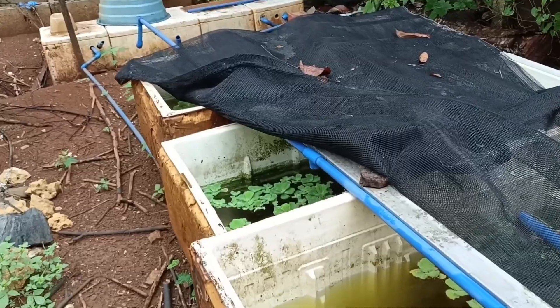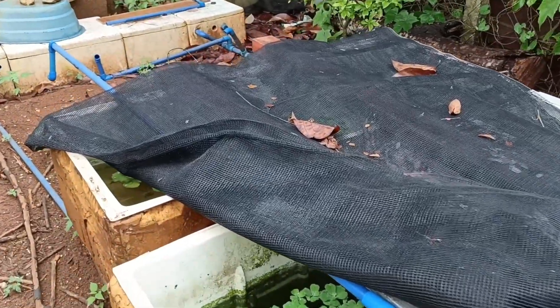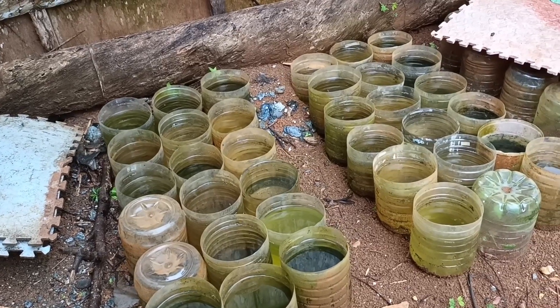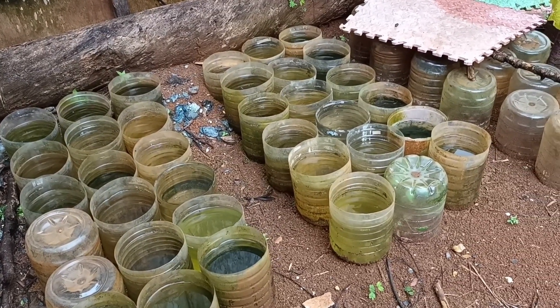It's not acidic but at the higher level it's alkaline. So I just wonder why my guppies in my outdoor pond are dying, since the rainwater is not acidic — it's in a higher range which is alkaline.